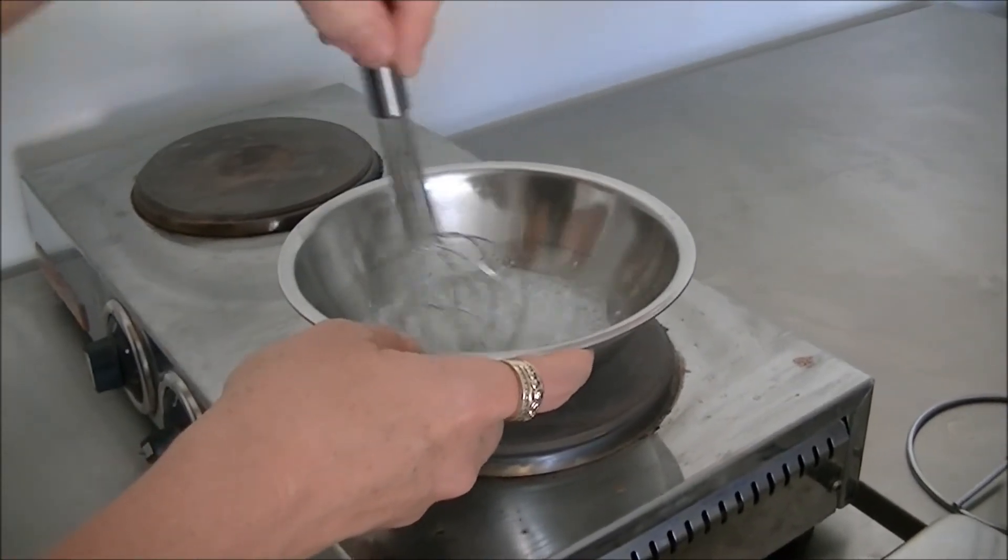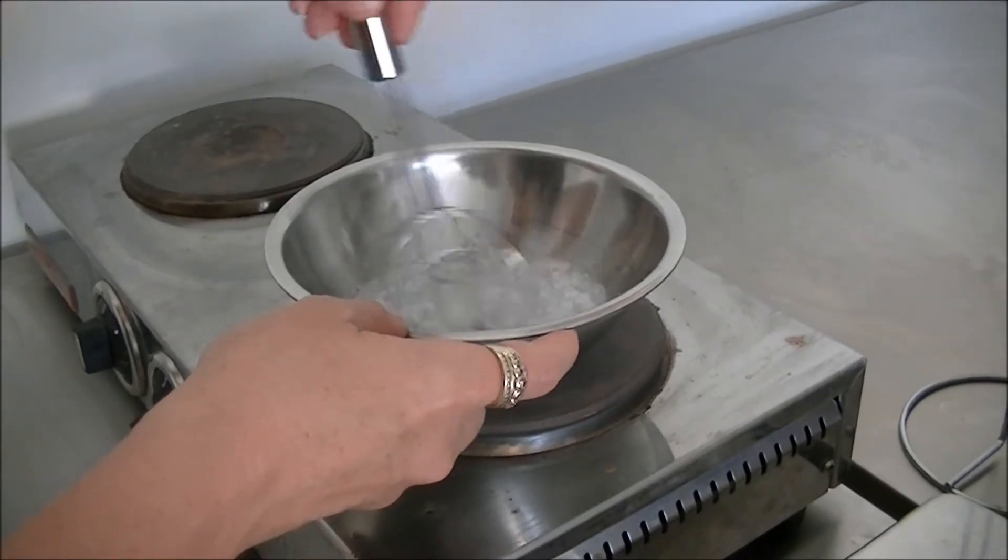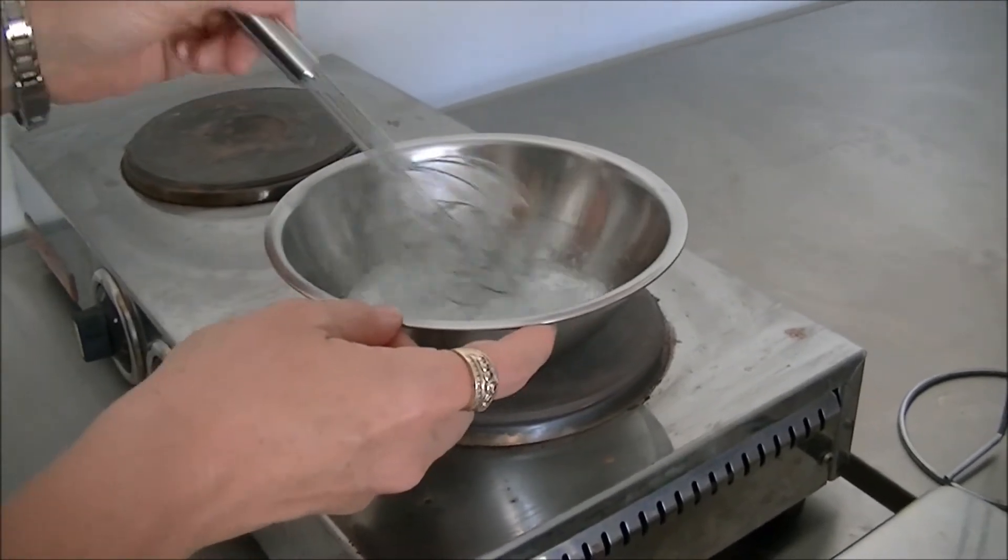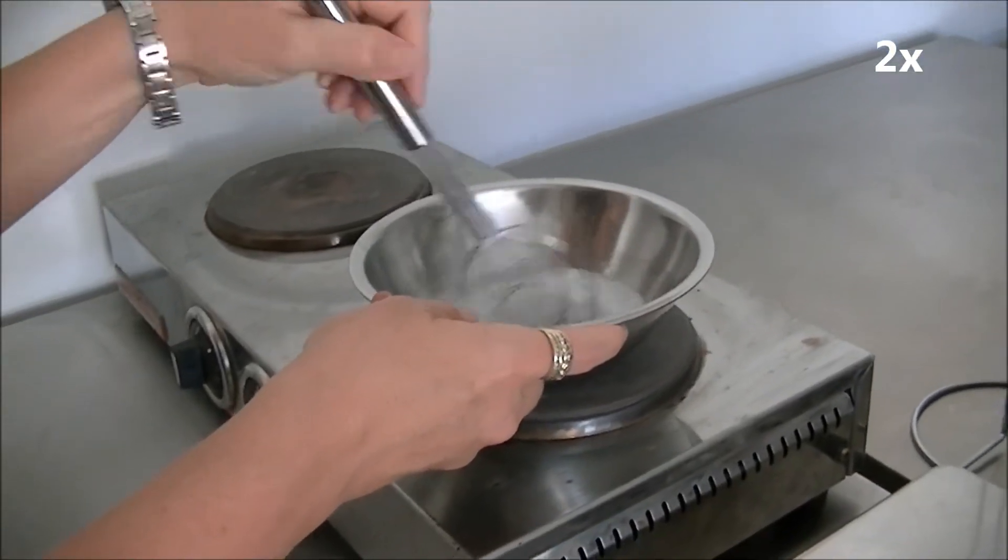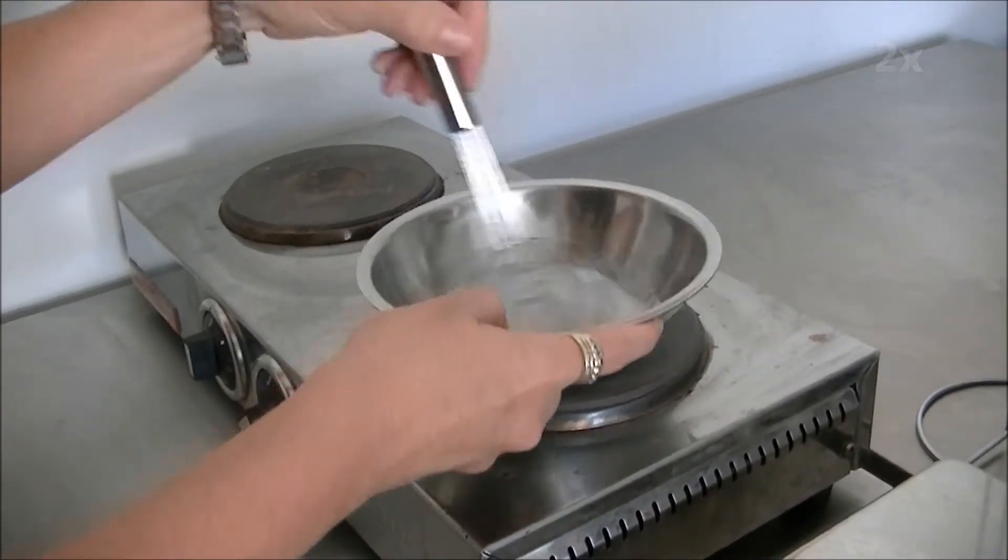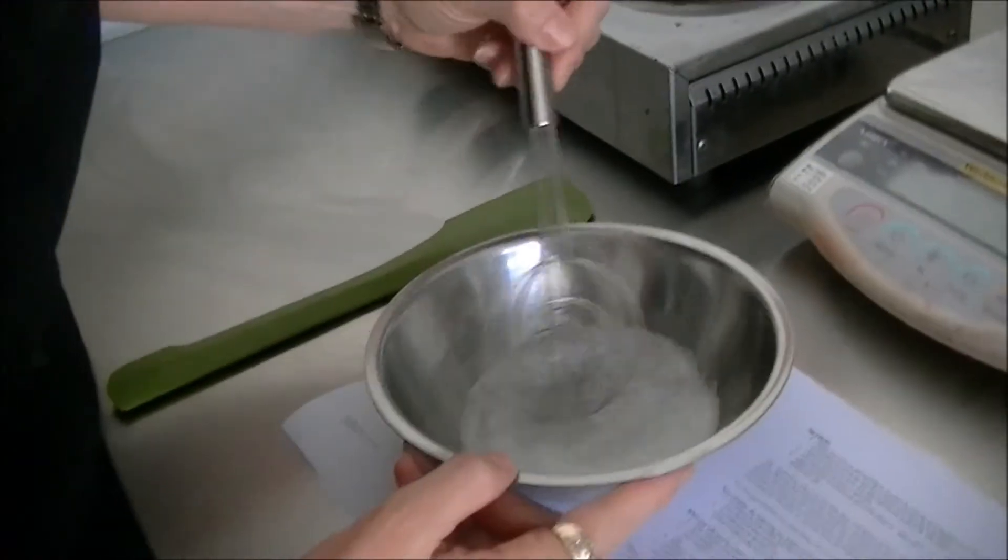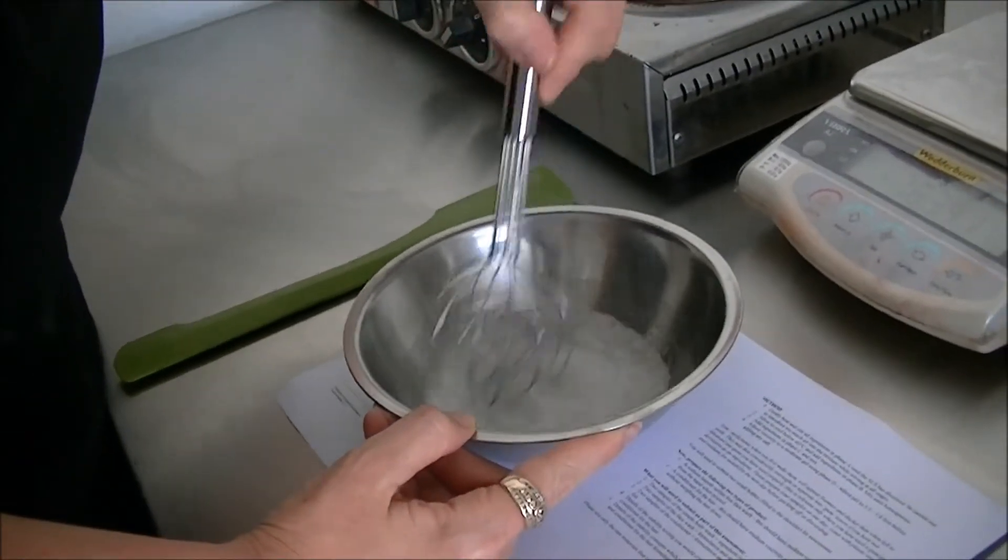I am stirring relatively gently. You can still see I'm getting quite a few bubbles. That really can't be helped. So all the needles have nearly dissolved now.